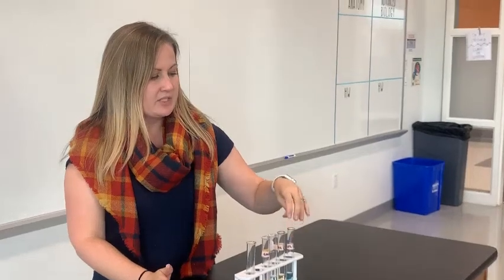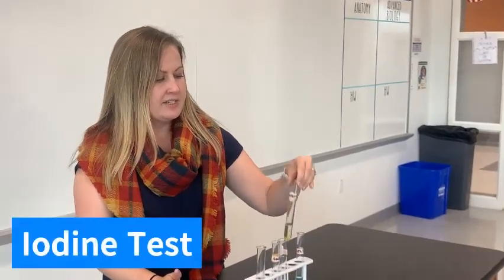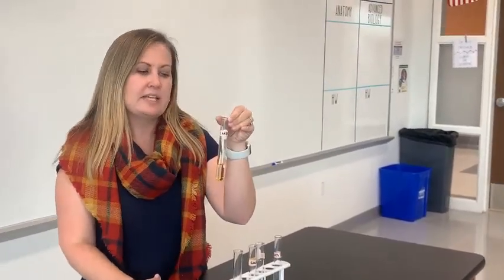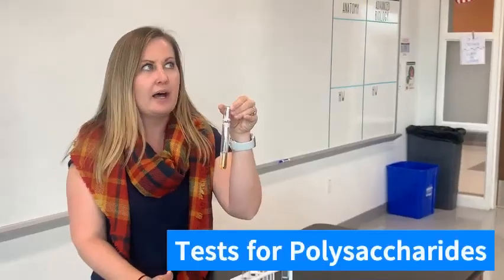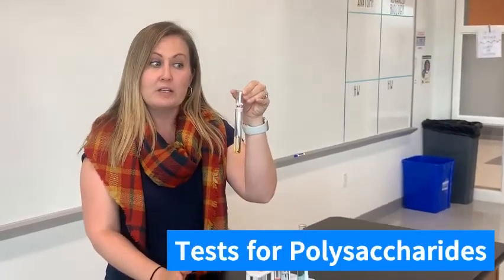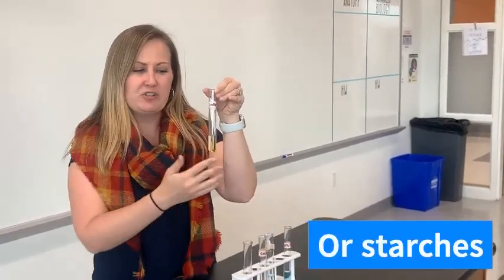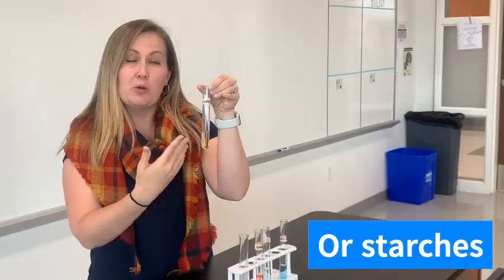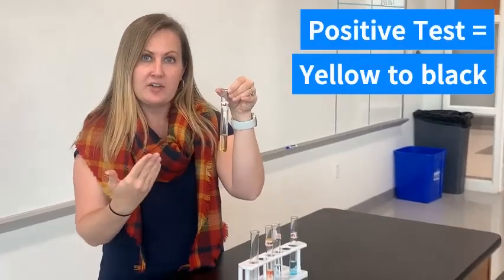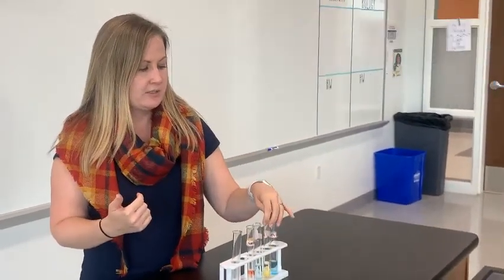The next test that was done was an iodine test. Iodine indicates the presence of starches — our big carbohydrates — and any change from this kind of yellow-brown to a purple-black tells us that starch is present.